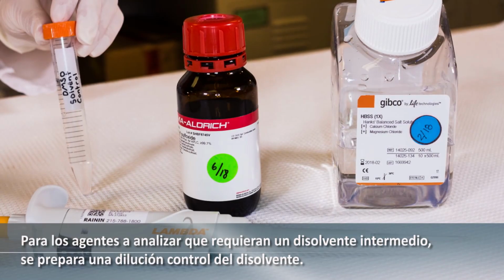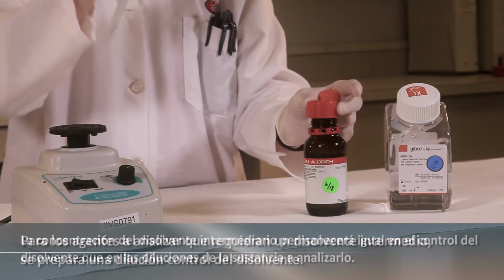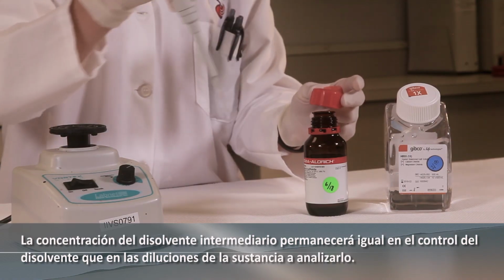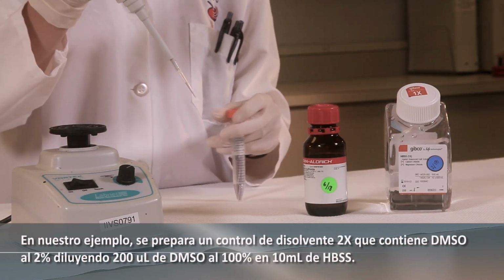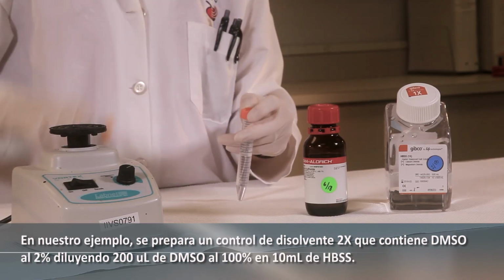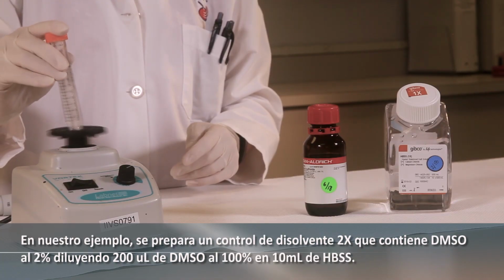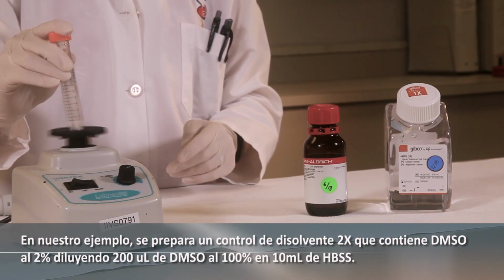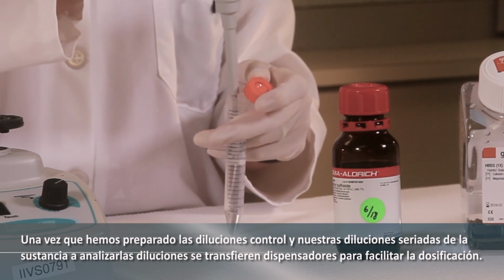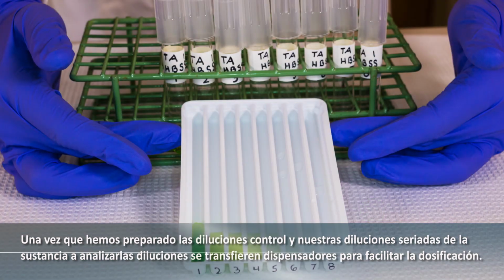For test articles requiring an intermediate solvent, a solvent control dilution is prepared. The concentration of solvent will remain the same in the solvent control as in the test substance dilutions. In our example, a 2x solvent control containing 2% DMSO is prepared by diluting 200 microliters of 100% DMSO into 10 milliliters of HBSS. Once we've prepared the solvent control and our serial dilutions of the test substance, the dilutions are transferred to reservoirs to facilitate dosing.